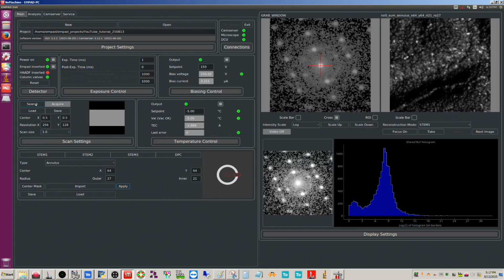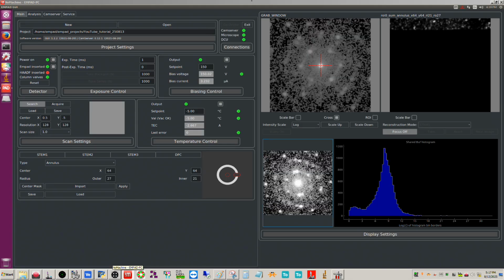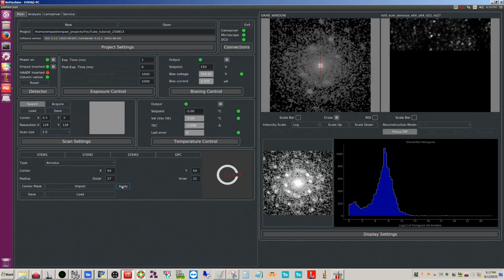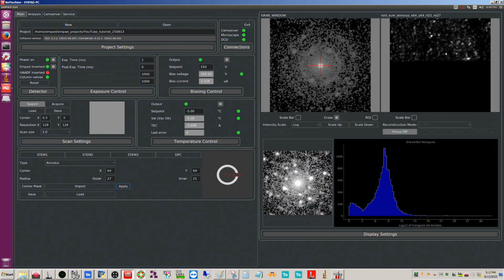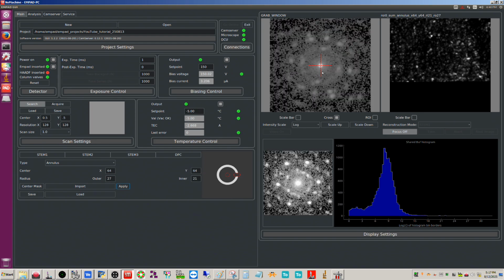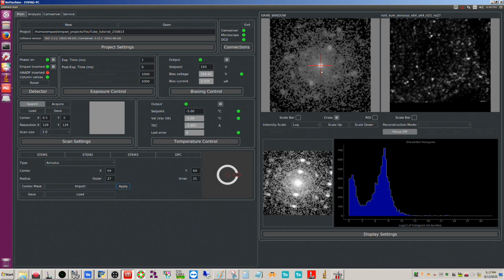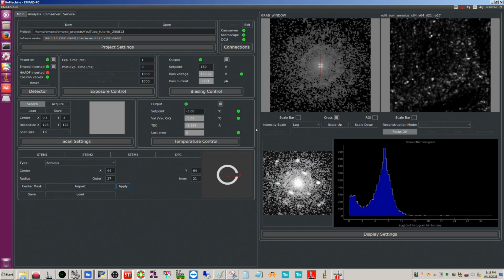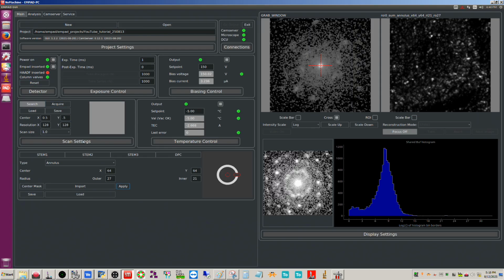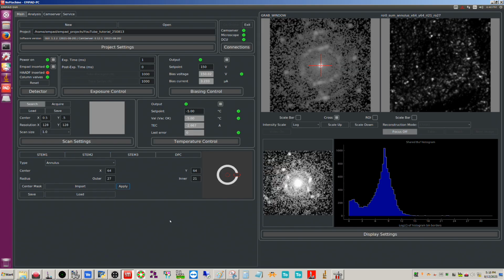So let's go back to search and click focus on, and let's see how this looks here. If we hit apply, yeah, that's exactly what that is. So now this is like a texture tool. We can see grains that have strong 111 reflection here. So it's pretty neat. You can isolate d-spacings with this, provided that they're not too tightly overlapping per se. All right, neat. And again, when we actually take the final image, it will give us these reconstructed STEM images, as well as a DPC calculation as well.